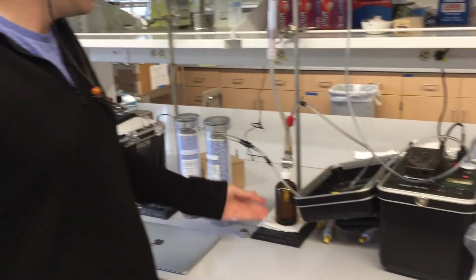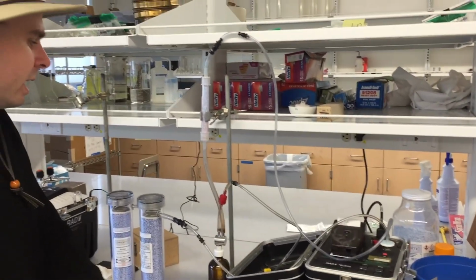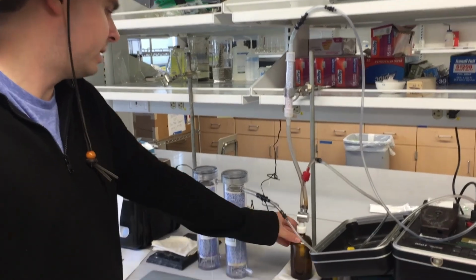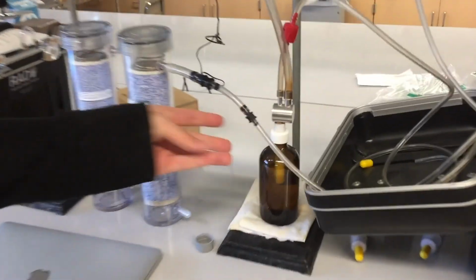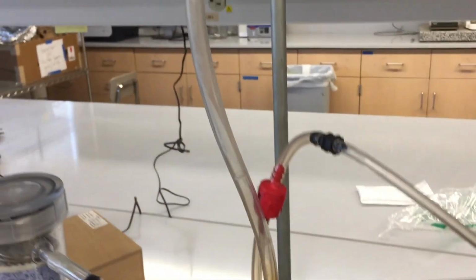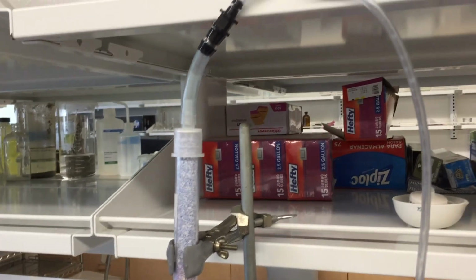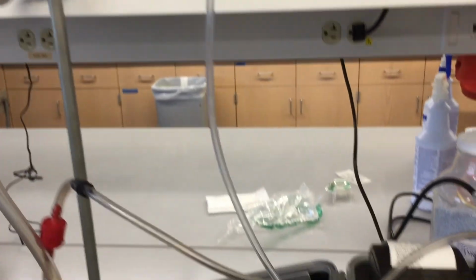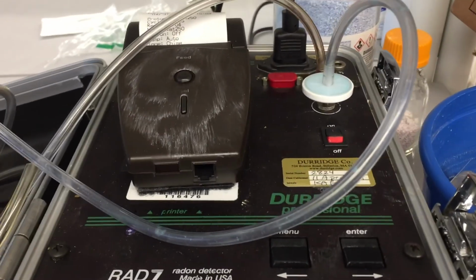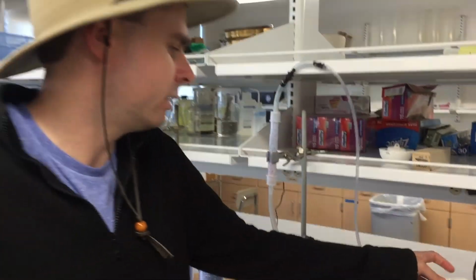Hi, welcome back to the lab. As you can see here, we've got our radon sample connected to our radon analyzer. What it's doing right now is aerating the sample and getting all the radon that we have collected in here, and it's bubbling out, going through all this dryer to get rid of all the water so that there's just pure radon-infused air. And it's going into this instrument here where it'll measure it and provide us with results.